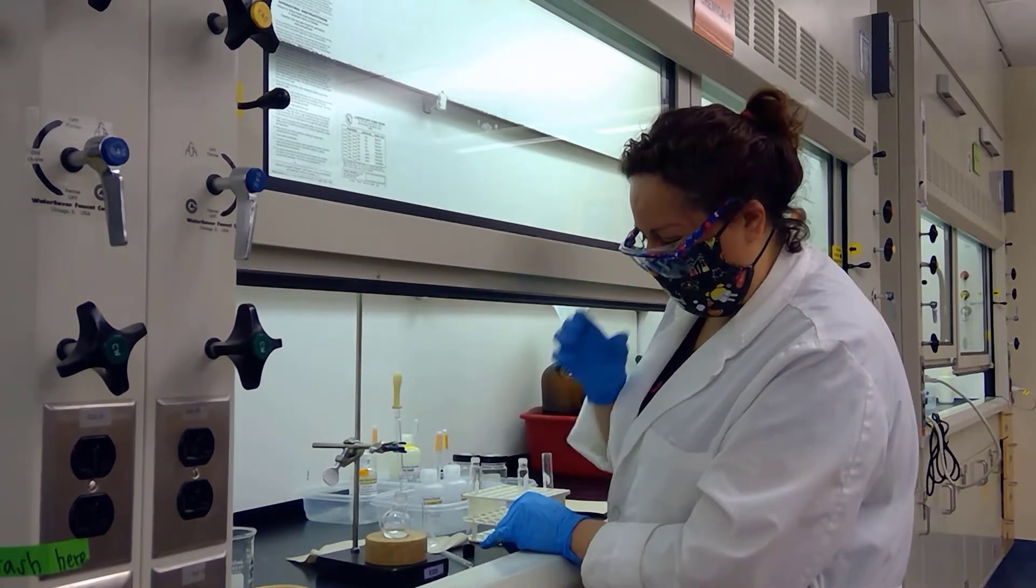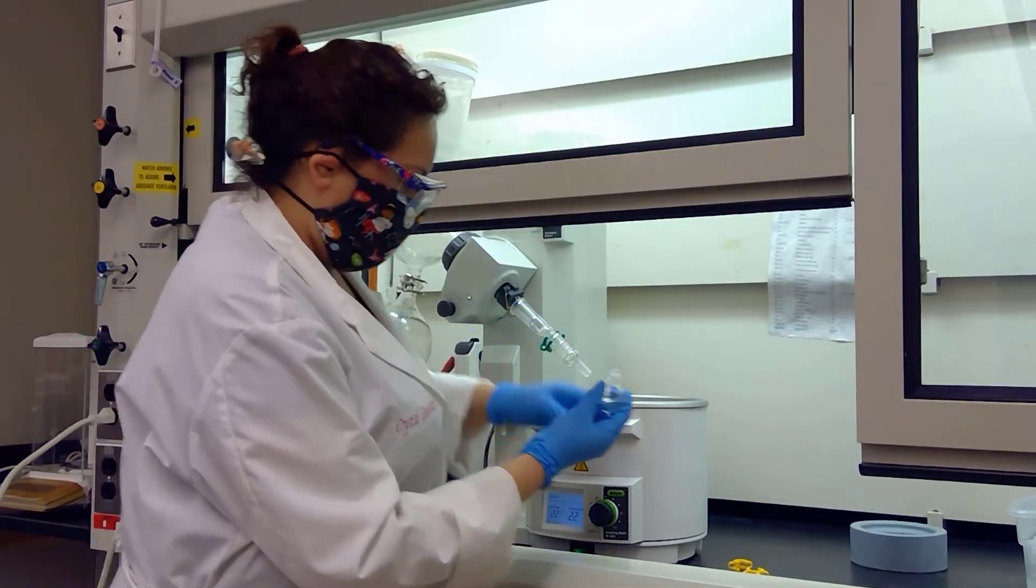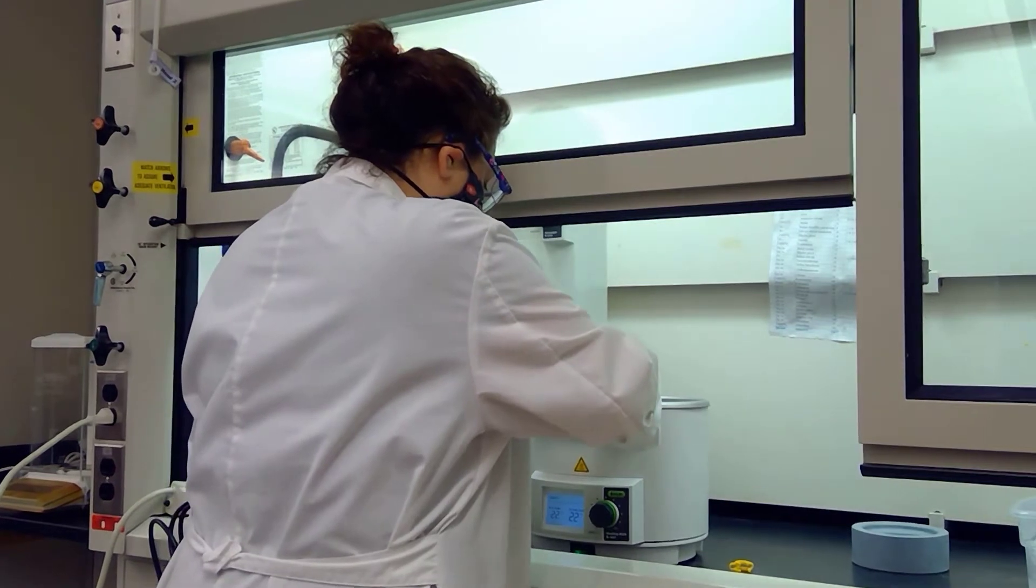We're going to go ahead and take this sample over to the rotavap and evaporate our solvent. Our sample is going to get connected to our adapter area.